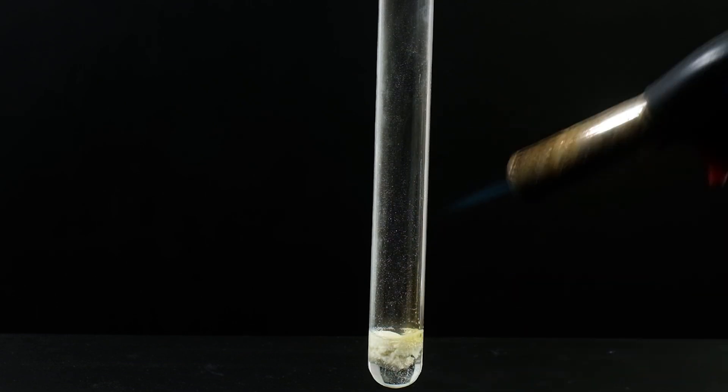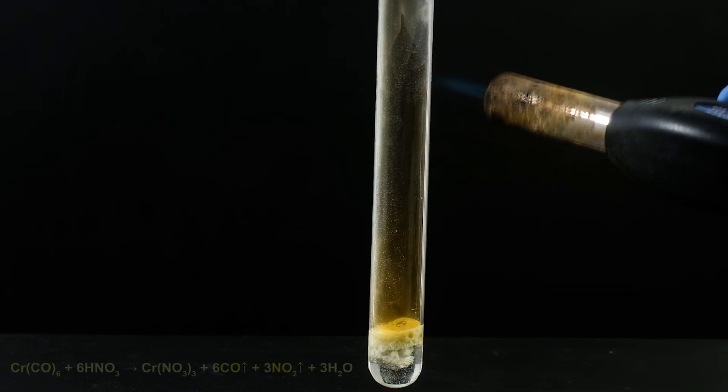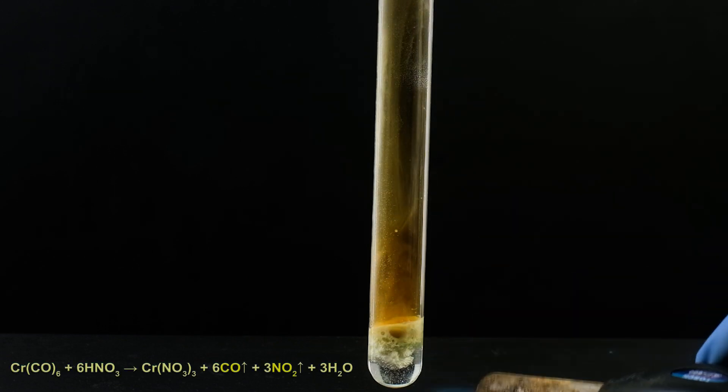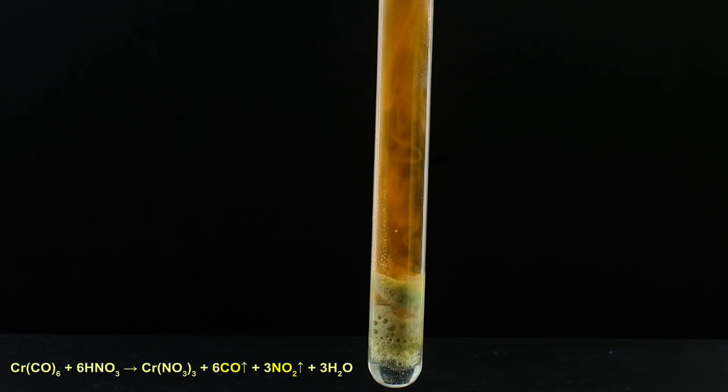You can see the clouds of orange nitrogen dioxide sent out. In fact, in addition to it, a large amount of carbon monoxide is formed that, when heated, reacts with nitrogen dioxide to form nitrogen monoxide and carbon dioxide.